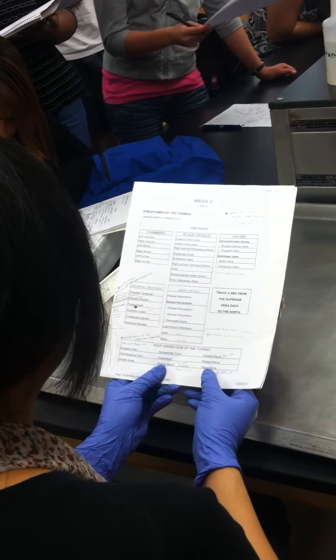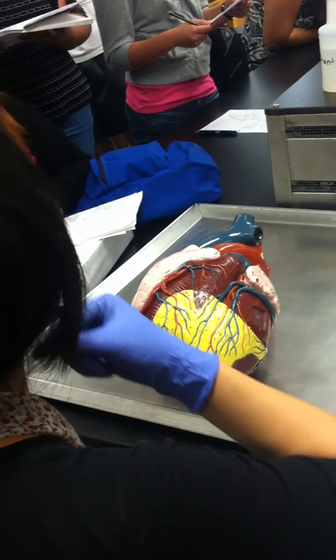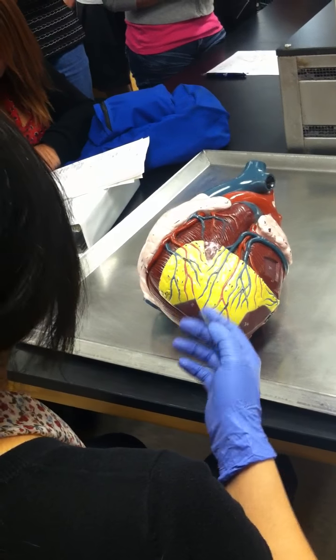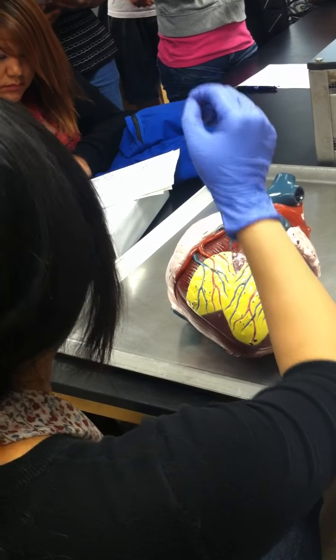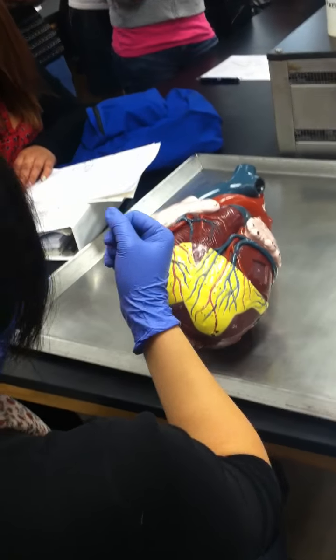Vagus nerve is one of the nerves that are to the side. Well, we're going to talk about this in a bit, but we have your common carotids up here. And then we also have our vagus nerve. So when you guys are dissecting, you will sometimes see your nerves, and they kind of look like dental floss. These white stringy things are tough, but still easily breakable.